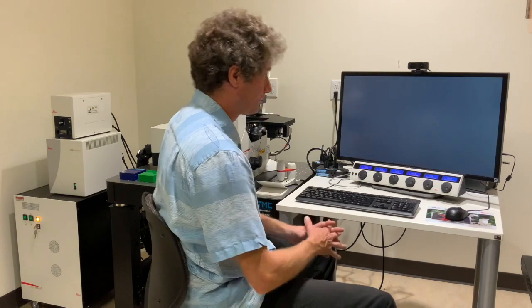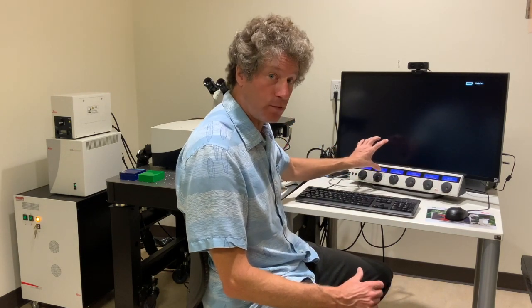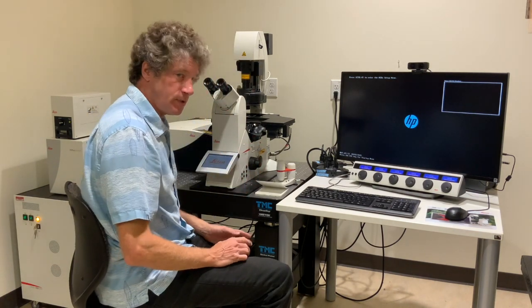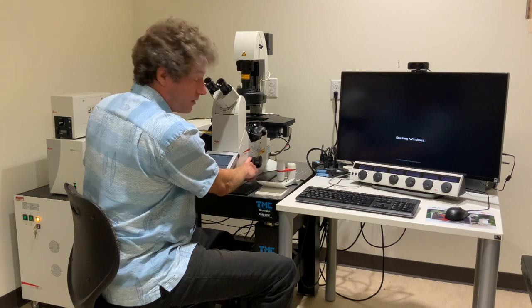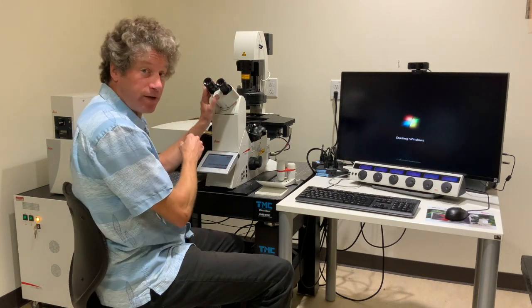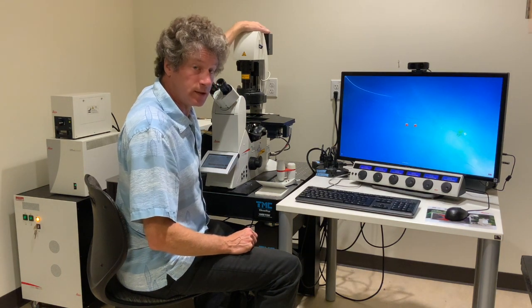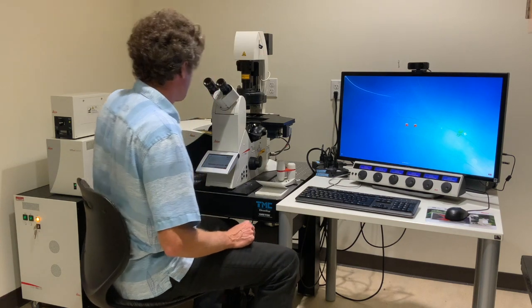Wait for everything to boot up. Let me run the layout. You've got a monitor, obviously. This has a whole bunch of controls for the Leica Confocal microscope — they're extra controls, also available in the computer. This is the microscope itself. The objective lenses are down here. It's all automated and controlled by the computer, however you can still control some things like the focus with the regular knob. Don't turn the objectives on your own — let the machine use the objectives. The oculars are for finding the sample. Up here there are several other additions: there's a fluorescence bulb like you learned in 102, and a few other features on top. The lasers are right here, and the power controls are right here.